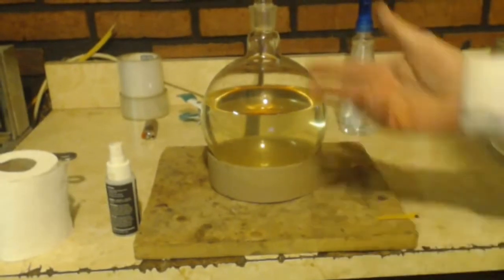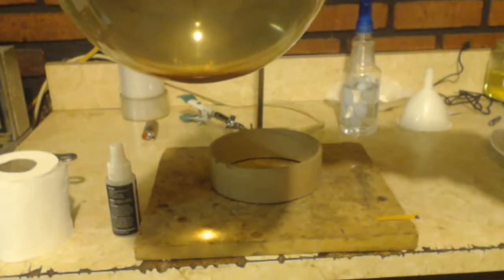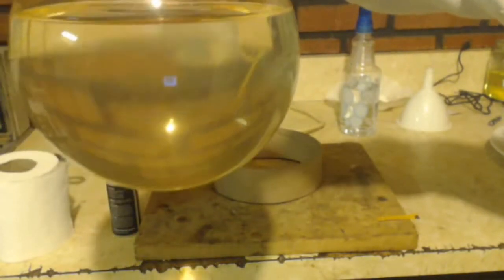I can toss that in the bottle. I'm just going to leave the solids in there. But I did a pH check of 12. There's my thing. You can see it's purplish. Anyways, I checked it on the chart. It's a 12 or about. So there you have it. So there we go. We got our sodium hypoiodite solution, which is basically iodine bleach.